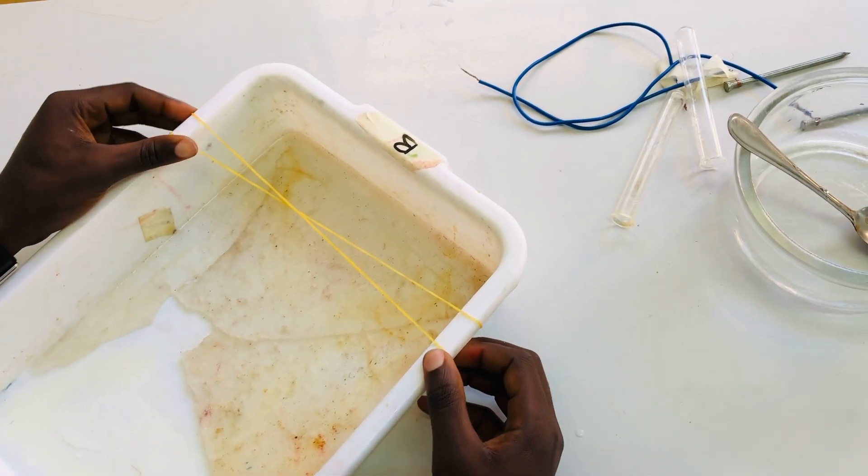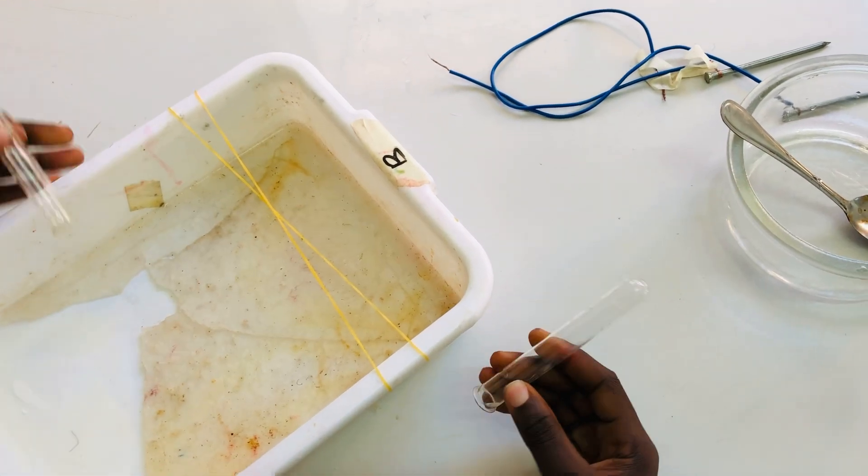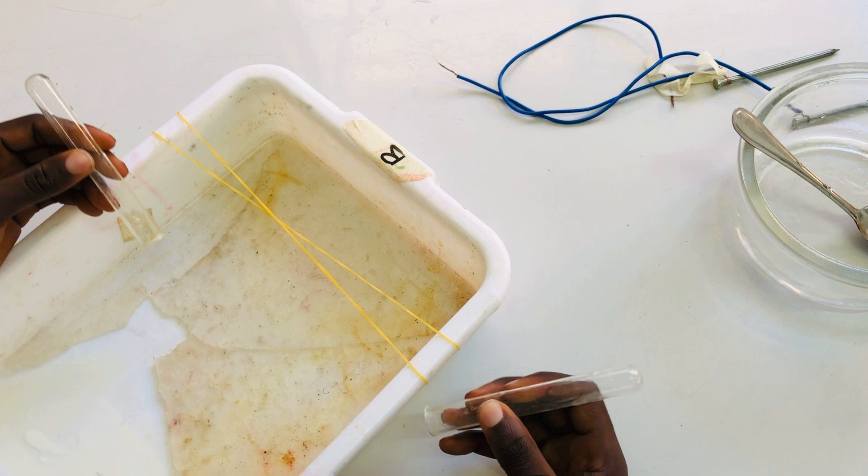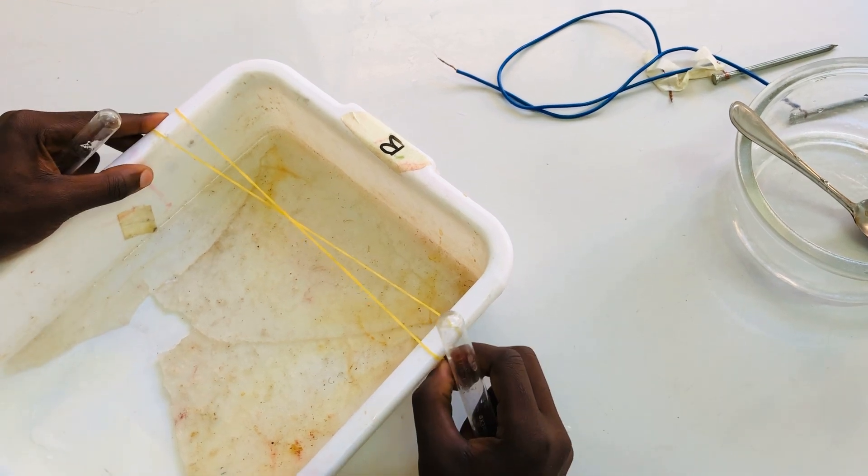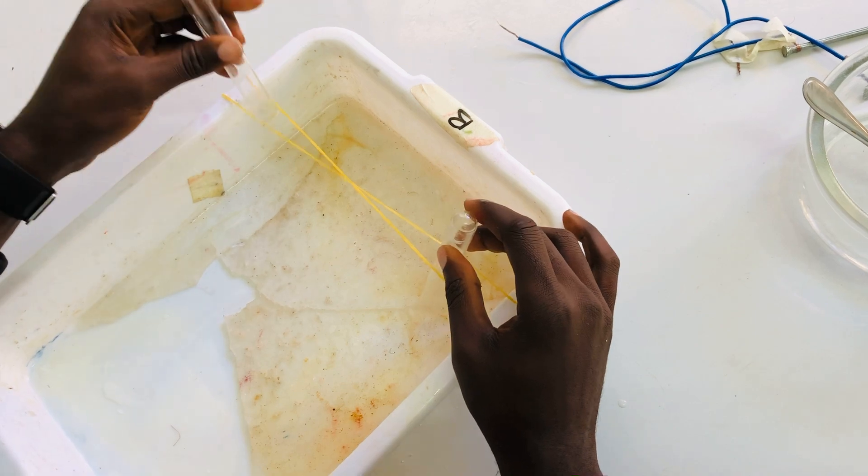This is step number one. Then after, we have to take two test tubes. One of these will collect oxygen and another one will collect hydrogen gas.